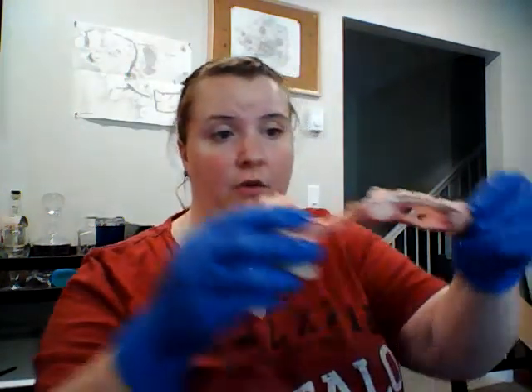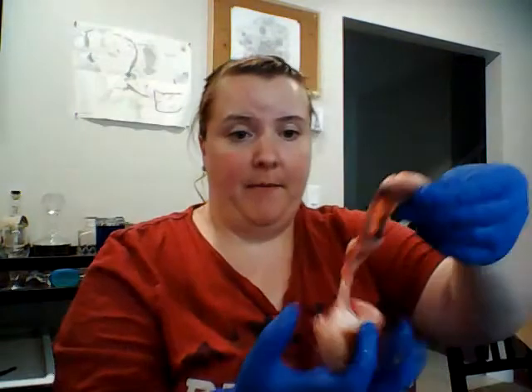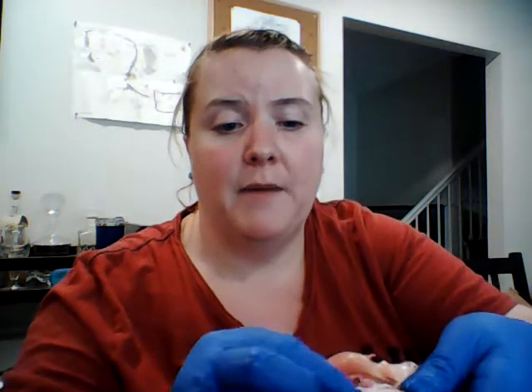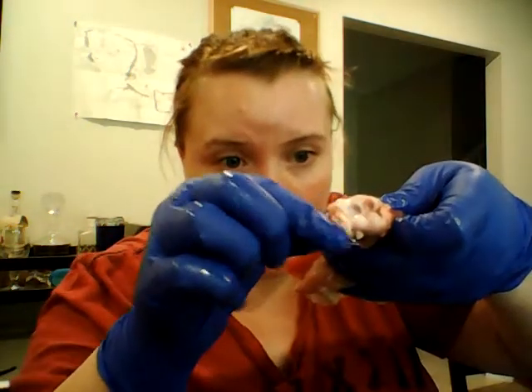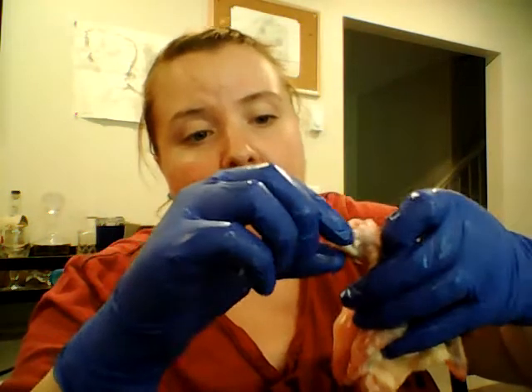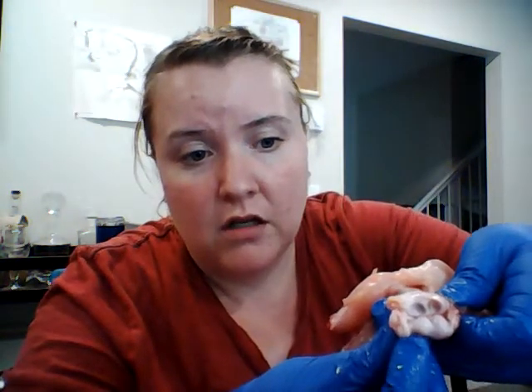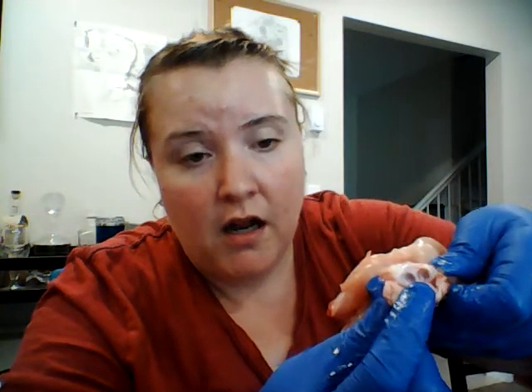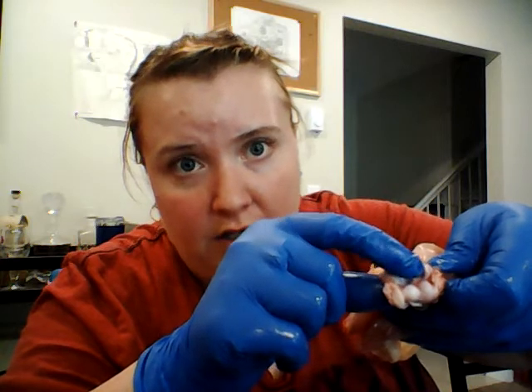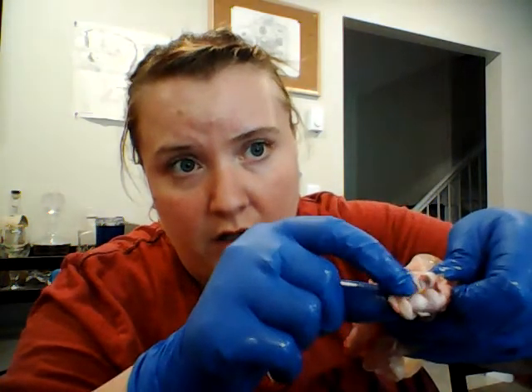So again, the way that the joint moves, oh, sorry, I had that down. The way that it moves is you have it going like this. And then all of this part right in here is the joint, like that. Then we have the articular cartilage. We have that synovial fluid that would be in here. And then we have the articular cartilage in here, the capsule here, the cartilage in here.